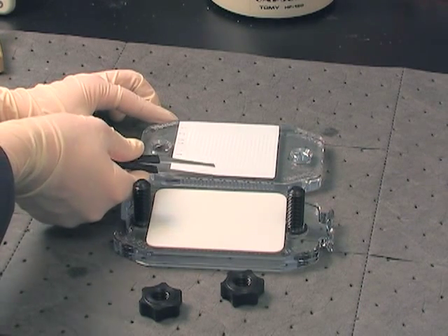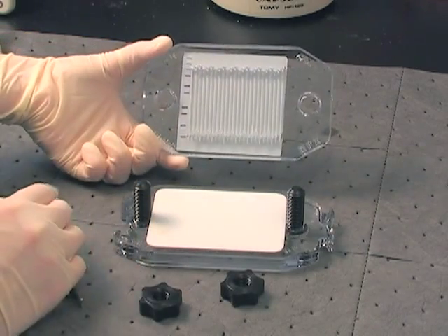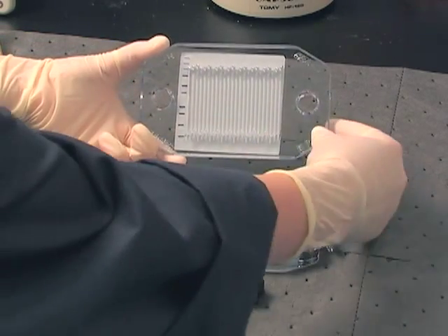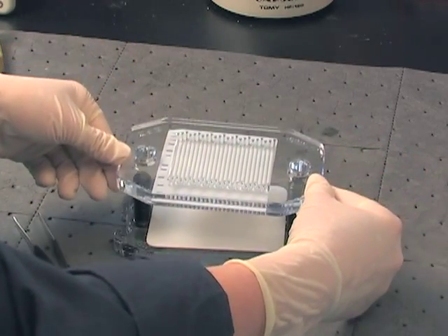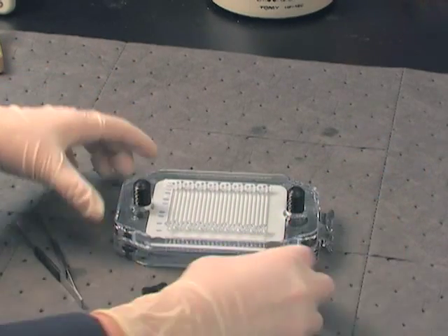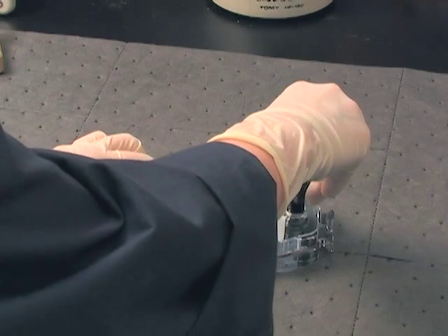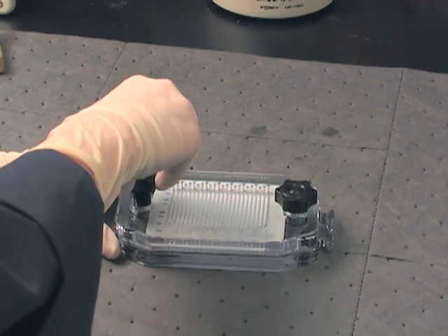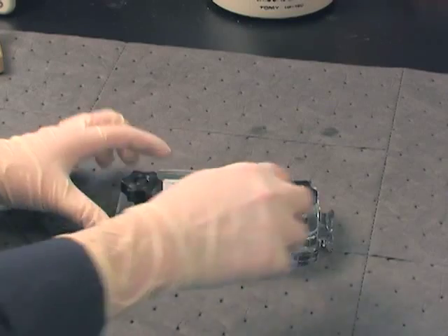Readjust the membrane if necessary and place the top plate on the base by rotating. Again, make sure the bevel ports are closest to you. Quickly check to make sure the foam cushion spans the length and width of the blot to assure the channels seal properly. Replace clamping nuts and finger tighten simultaneously.